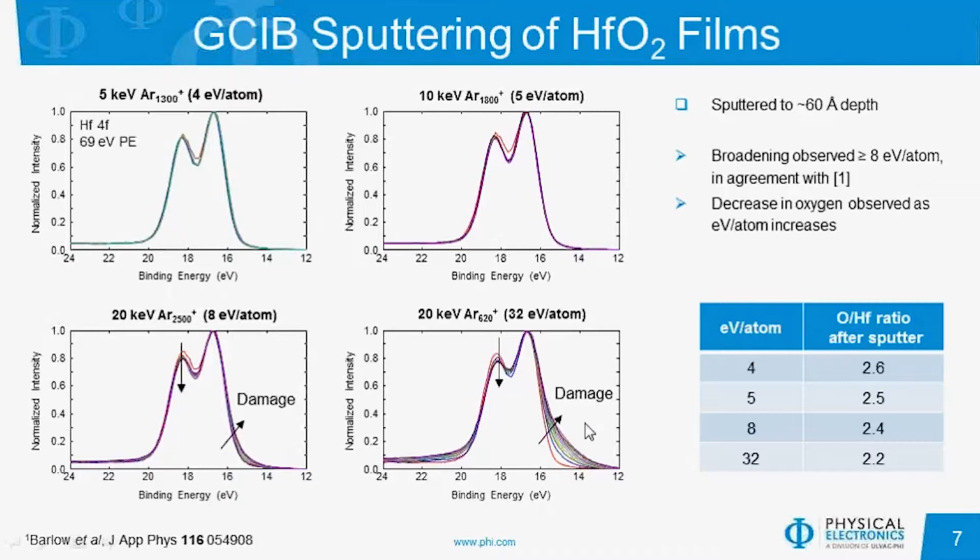And that is also shown when we increase the energy per atom. So we do not see that. It is not apparent in the spectra for the 5 eV per atom and below. And this is in agreement with literature that approximately 6 eV per atom was a damage threshold that could be observed in the peak shape. We also notice that as we do increase the eV per atom, there is a decrease in the oxygen to hafnium ratio after sputtering, which is consistent with loss of oxygen as we increase the energy.